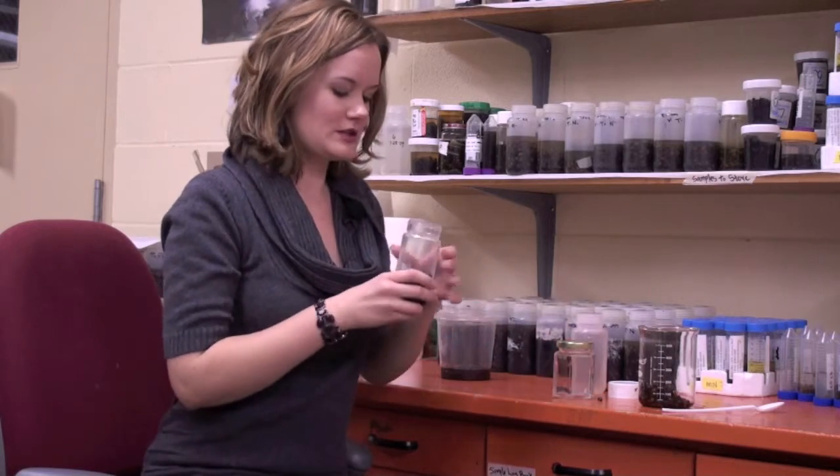Now if your colony is not doing well, I understand if you can't give me that many bees, but it's better for my analysis and more accurate data-wise if I can get half a cup to a cup of bees, if you can do it. So here's your bees. This is about half a cup to a cup.